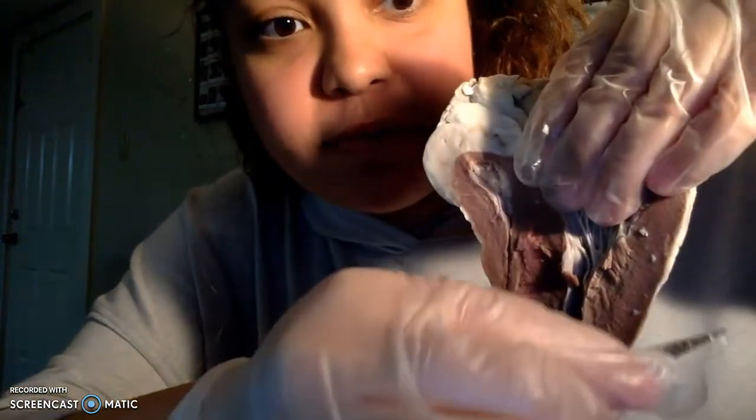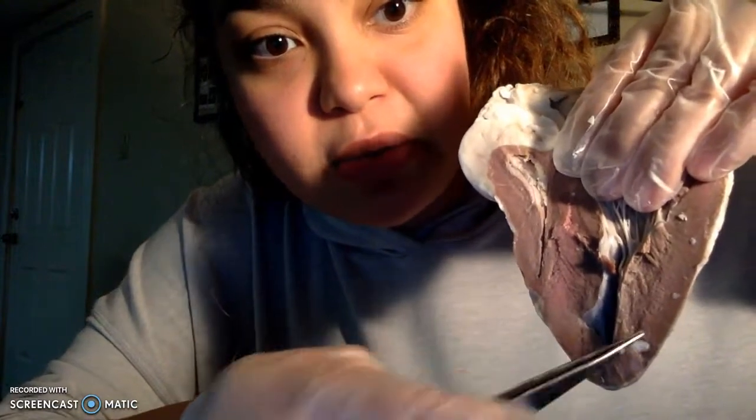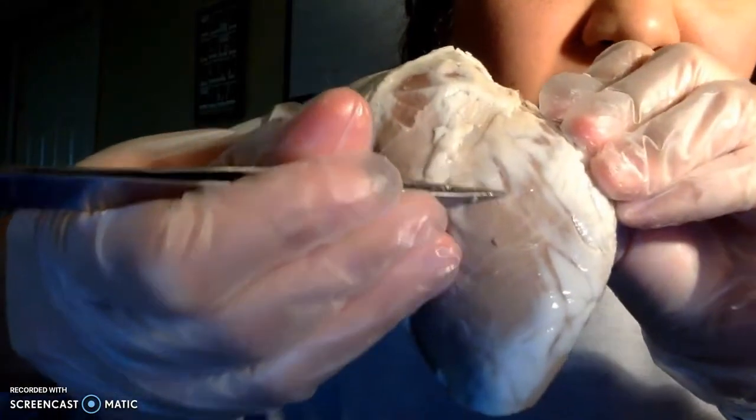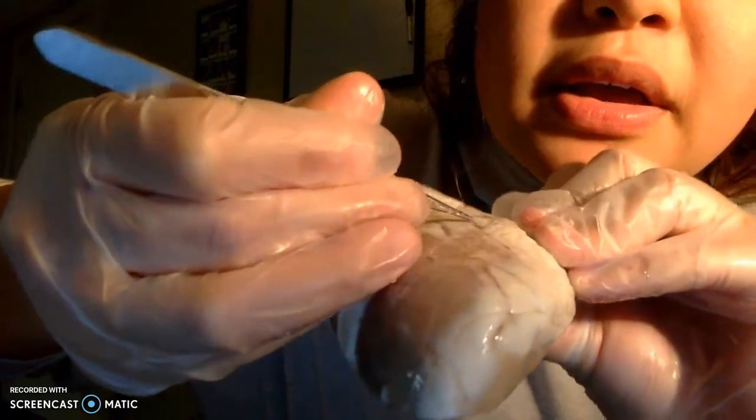So like I said, superficial is the epi, myo is right here in the middle, and the endo is the inside right there. And then the last thing is the coronary arteries, which we can't really see that well, but I will try my best. They're sticking out, kind of, you can see it in this light, but they are these right here. They kind of look like lines almost. Right there, and we have one running down right here.